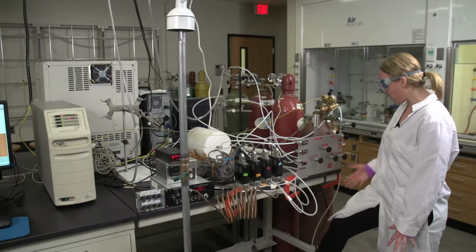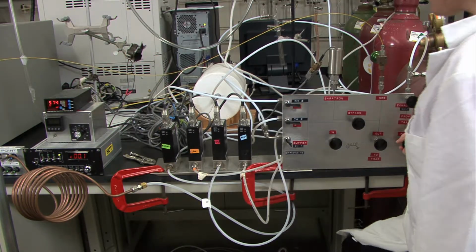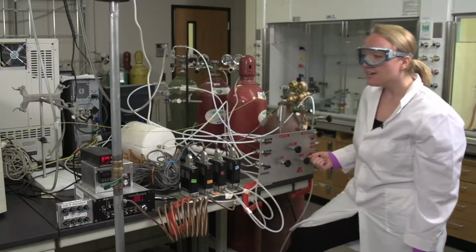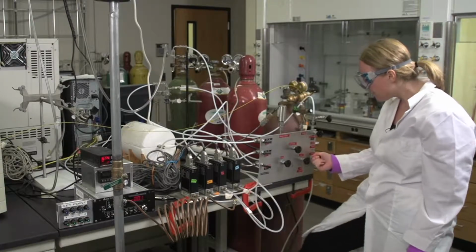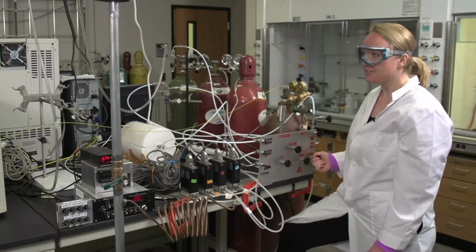So after you've got the pump on, you'll need to turn off the exhaust valve and then turn off the atmospheric vent valve. And then you'll need to close the pump valve and then watch the pressure build up in this box. So it should get up to like 550, and then you'll need to slowly release it, just ever so slightly, until it starts to hover around 450. And then that will be a sufficient pressure so you can collect a scan.